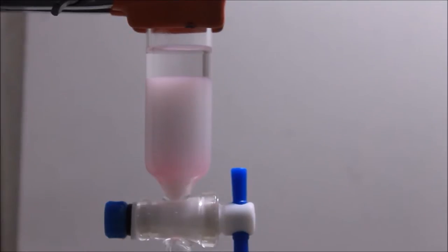In this experiment we will perform a simple demonstration on how to separate two organic dyes: fluorescein and safranin.